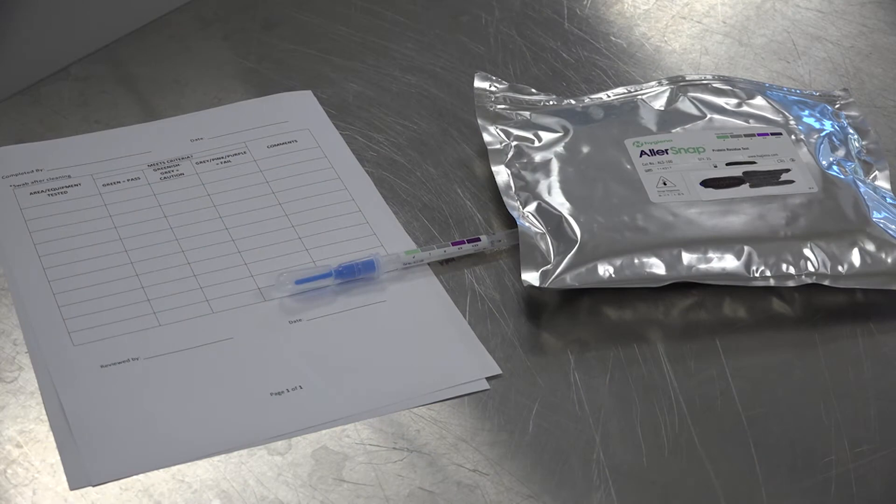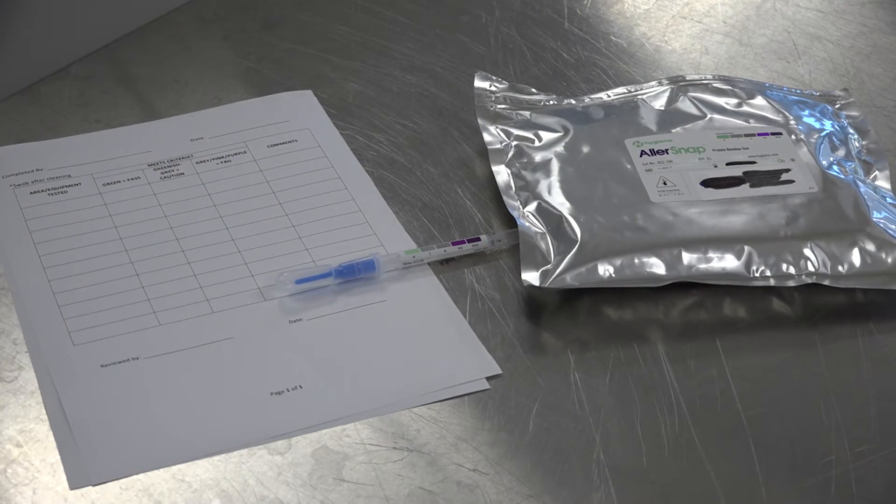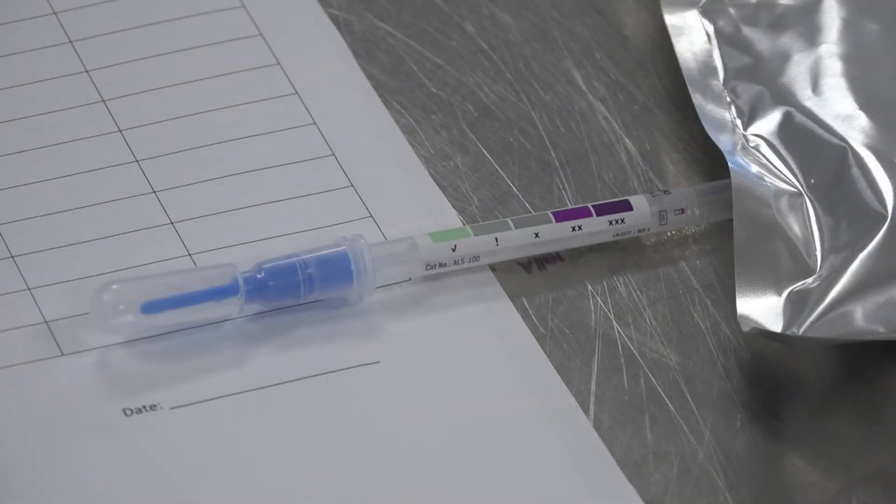Allersnap rapid protein residue tests detect a broad range of proteins using one simple swab device, verifying whether surfaces have been adequately cleaned to remove protein residues.